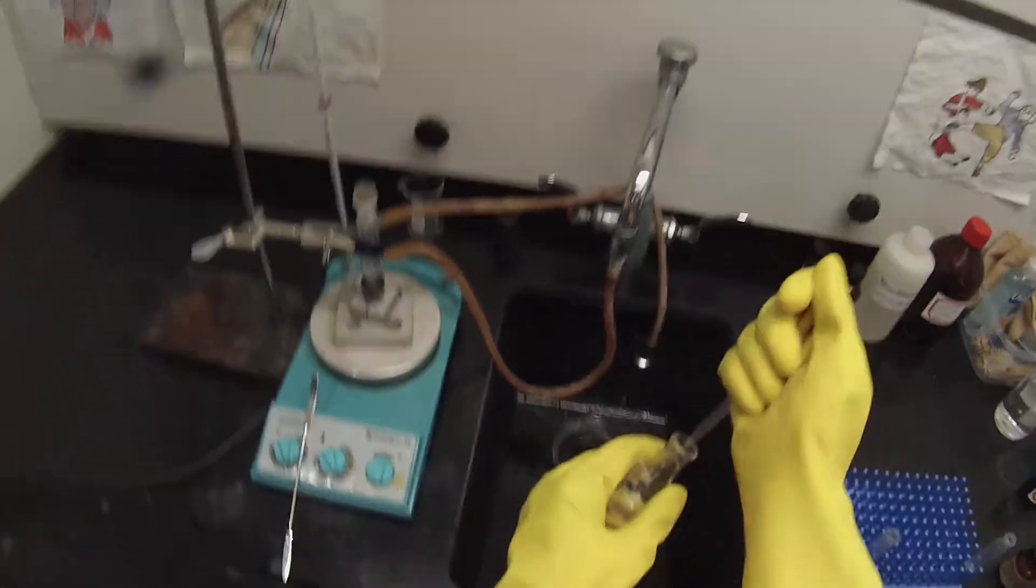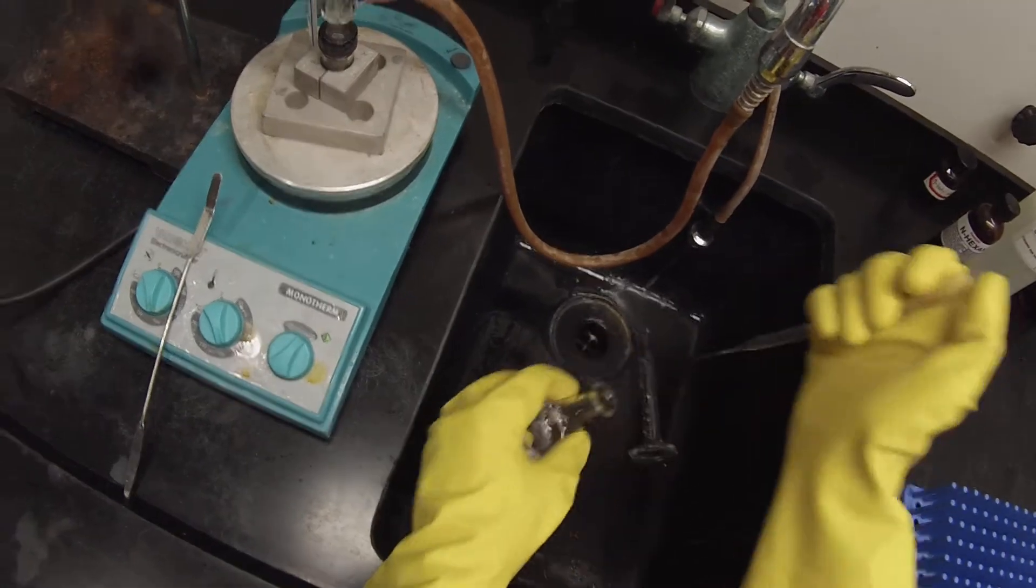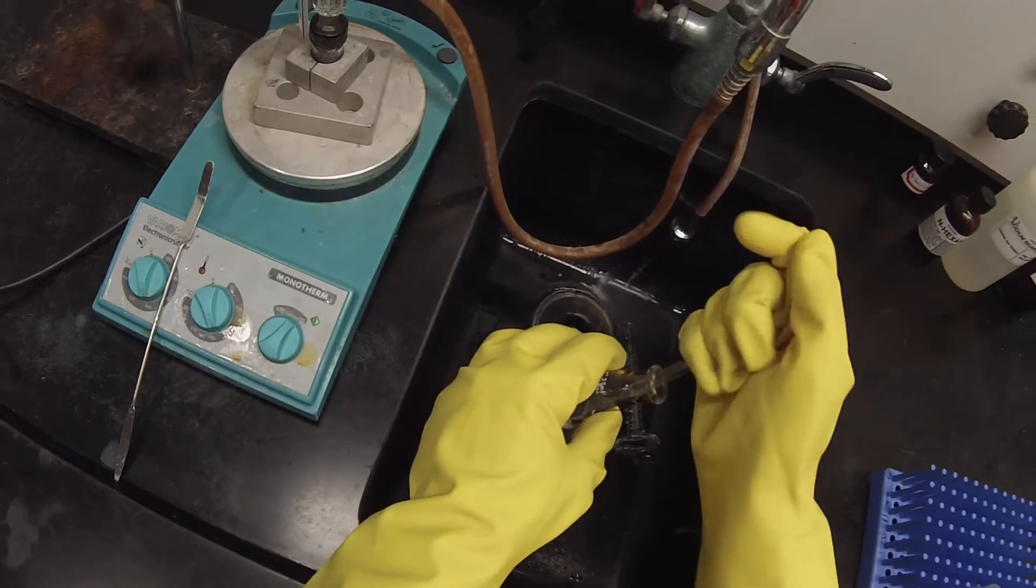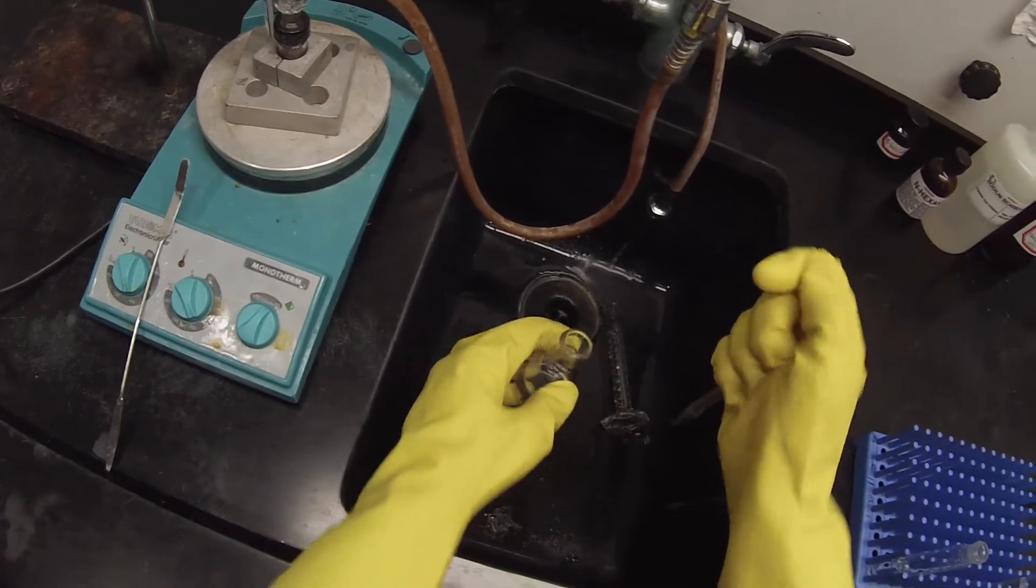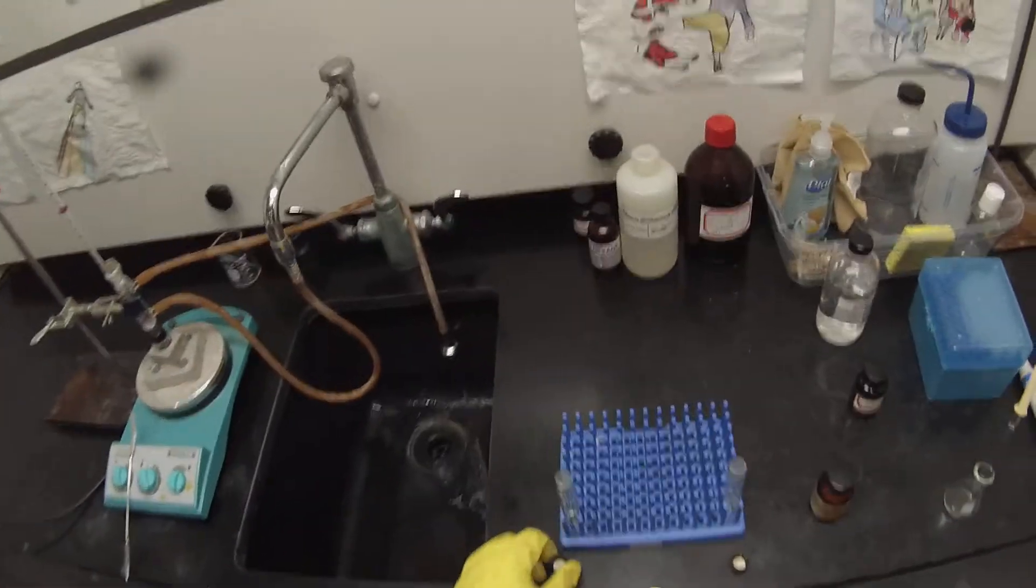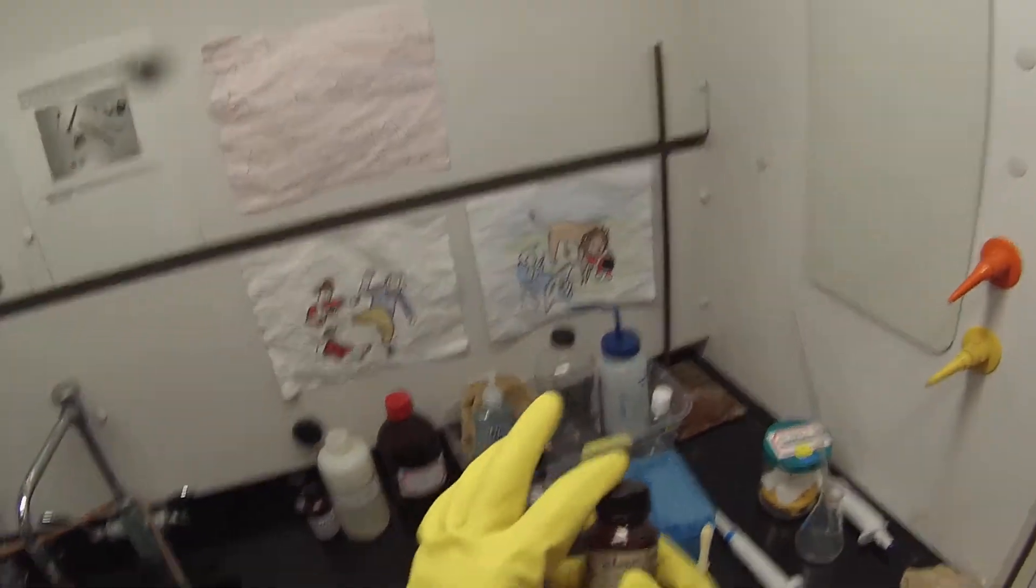And at this point I'm done with the pipette that had the acid in it. So I'm going to rinse that pipette before I toss it in the glass waste. So I don't get a bunch of acid in the glass waste container. Put the pipette back. I'll need it again later. For now I'm through with that. So before we add our t-butanol to our centrifuge tube, we need to prepare our conical vial with sodium carbonate in it.